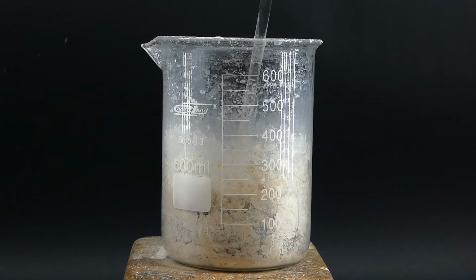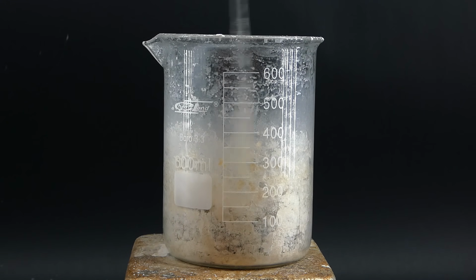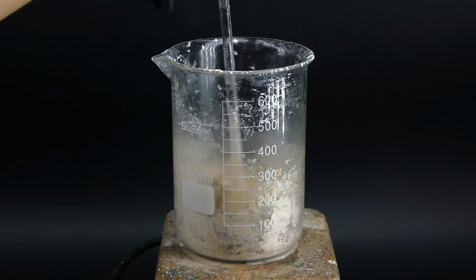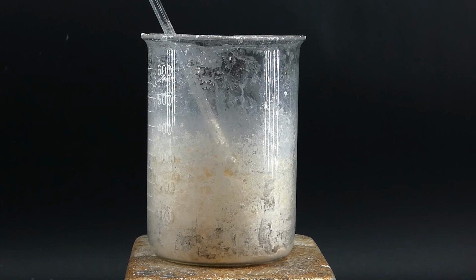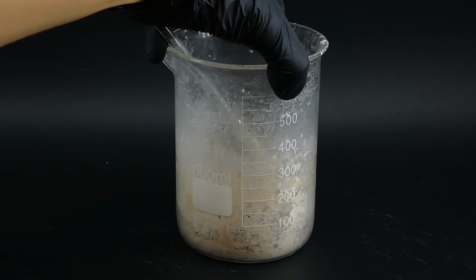anhydrous product. When the sodium acetate was dehydrating, I stirred it pretty much the whole time to prevent the formation of a large crystal brick on the bottom of the beaker. I managed to keep most of the sodium acetate as a powder, but some of it still adhered to the beaker, and that made me quite sad. When it looked like no more water was evaporating, I turned off the heating and allowed the beaker to cool down. Its inside looked rather ugly.